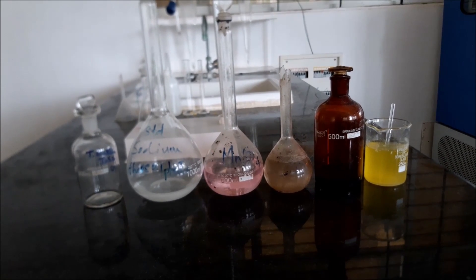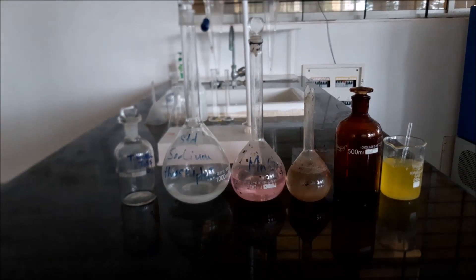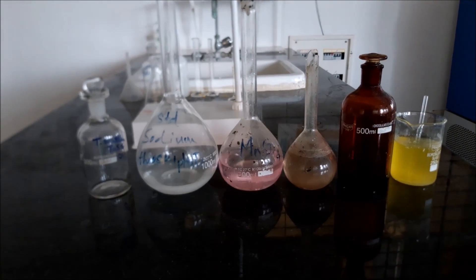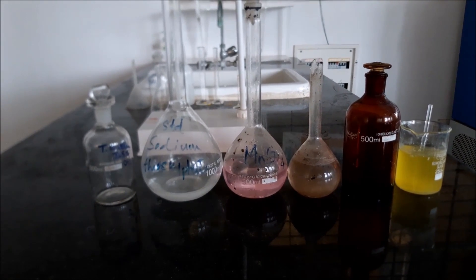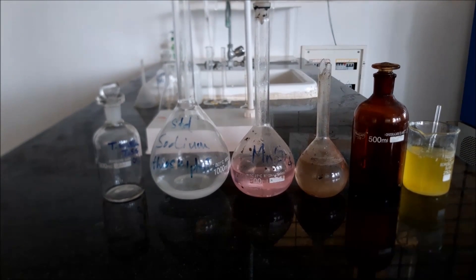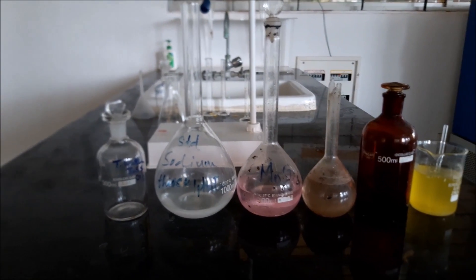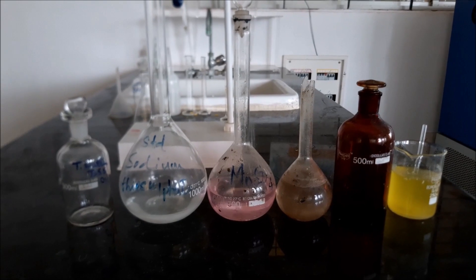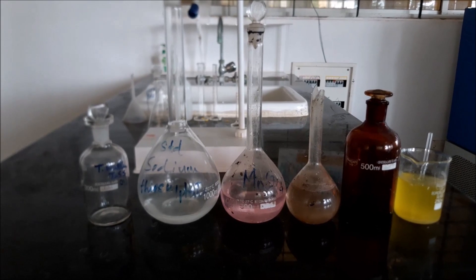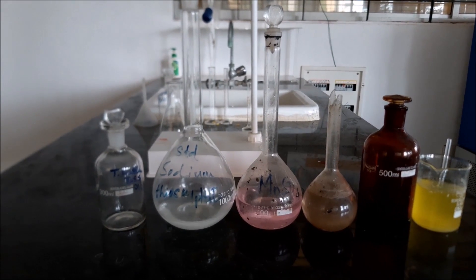Today we will be determining dissolved oxygen, that is DO. As you can see, we have prepared the reagents before as per the procedure given in the manual. The reagents are manganese sulphate, alkali iodide azide, starch indicator, and we will be taking standard sodium thiosulfate in the burette. We have also taken concentrated sulphuric acid. As a sample, we will be taking STP water, that is sewage treatment plant water.